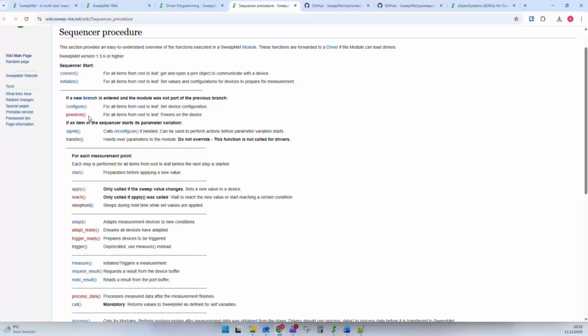If this is not the case, you can throw an error in the driver. It means raise an exception, and the measurement will stop. So you can very early detect these instruments. You don't have to wait until they are used in the measurement and then raise an error. So you can really detect this very early. The next phase in our SweepMe drivers is when you come into a branch. So what does it mean?